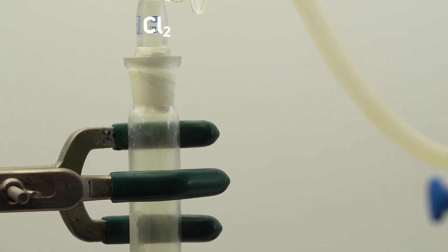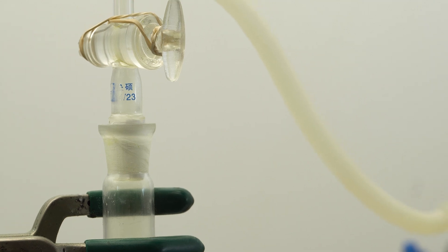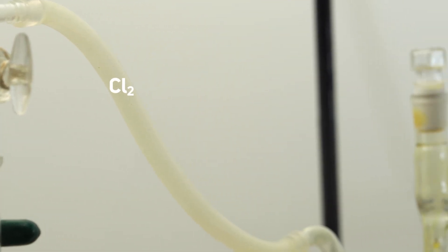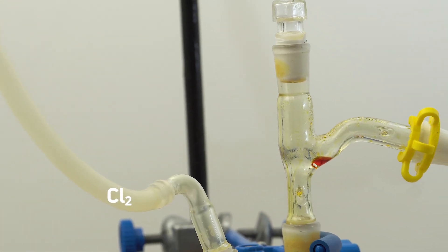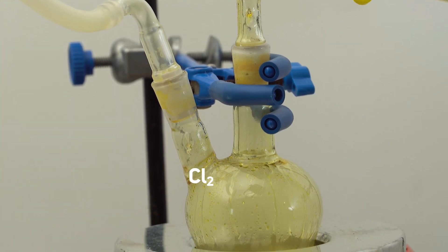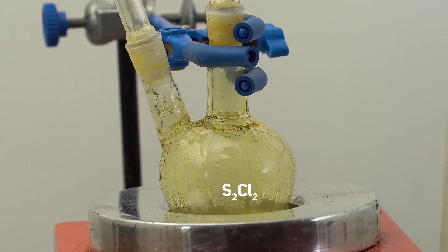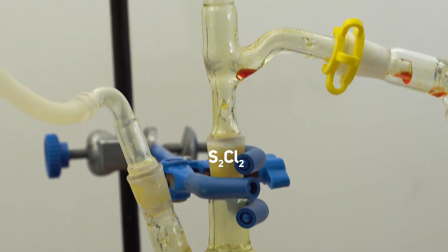The chlorine, which gradually evaporates from the test tube, will enter the flask with molten sulfur and react with the sulfur vapor, forming disulfur dichloride, which will then condense in the straight condenser and drop into the receiving flask.